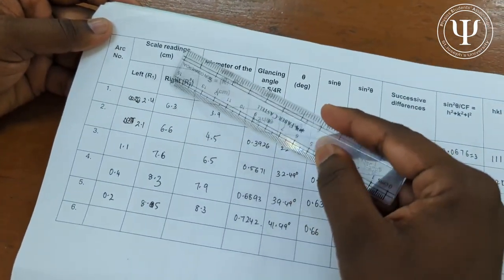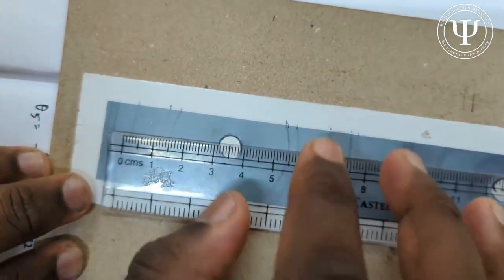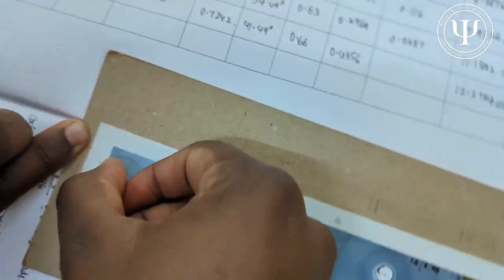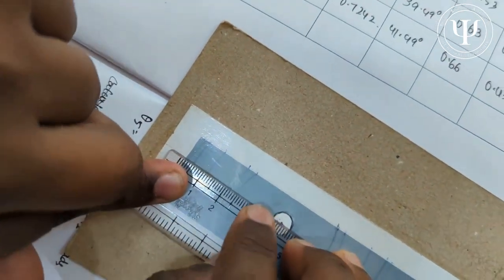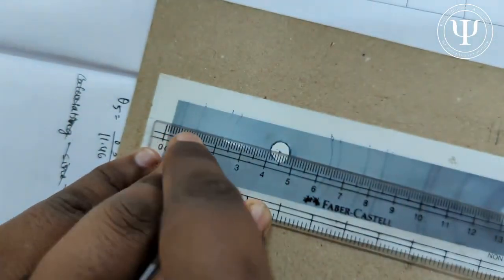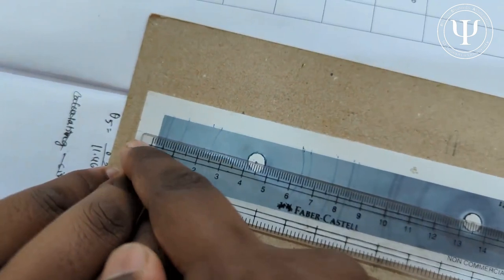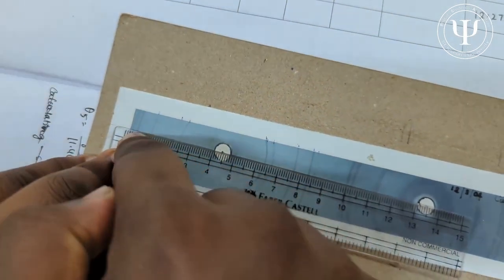We need scale readings in centimeters for the left arc and the right arc to find the diameter. Place the scale exactly in the middle, passing through the center of the small circle, and take the thin black line as the reference line. This left-hand side gives the left arc readings and the right-hand side gives the right arc readings. Measure the distance from the reference line to each arc.